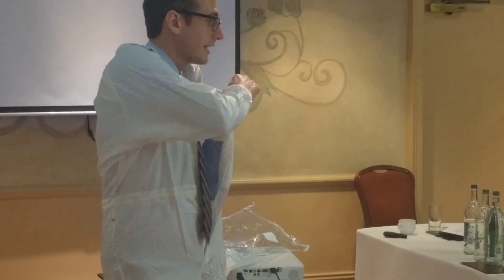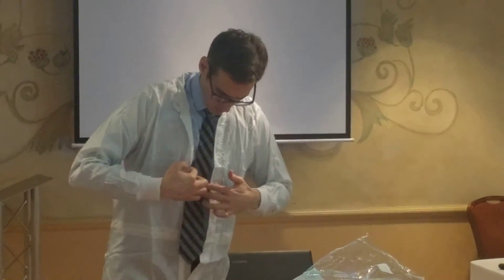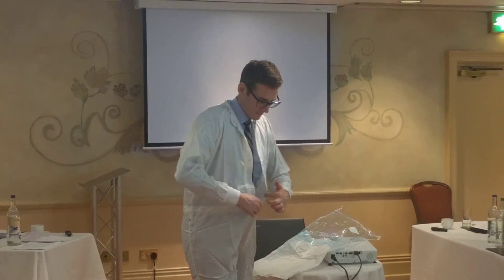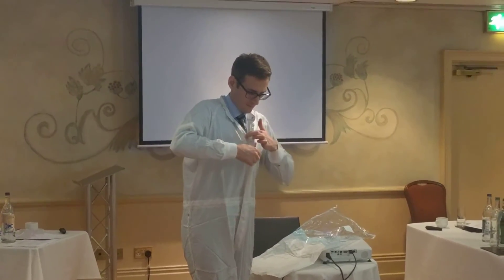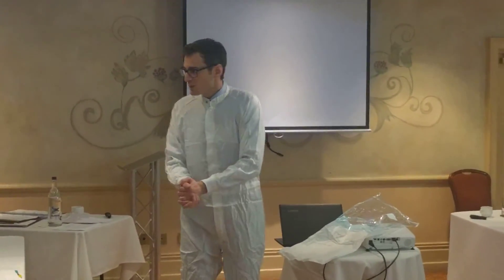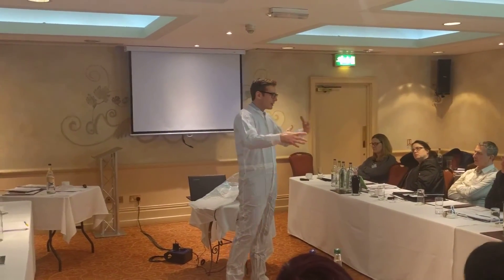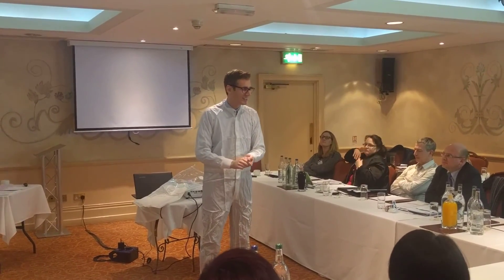In the clean room airlock I have a mirror where I can keep control of what happens. And again closing it by crossing the legs. So it's up to you which technique you want to apply. We've prepared some overalls outside where we have a bit more space and more air to breathe, and in smaller groups we can evaluate the best practice.